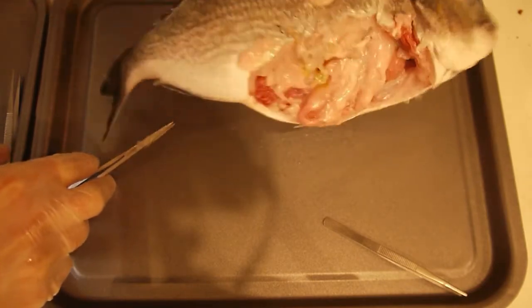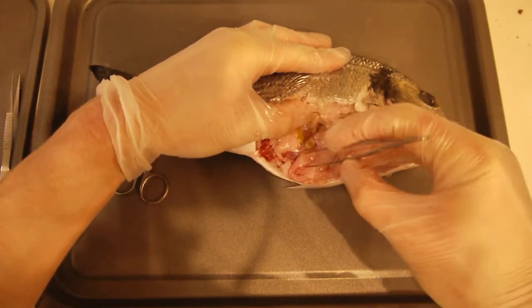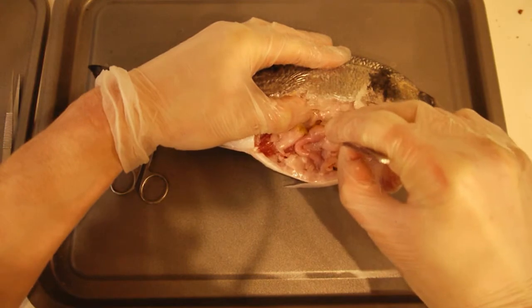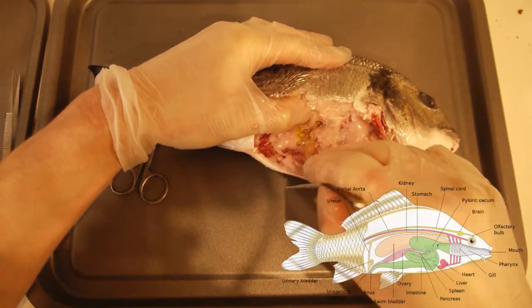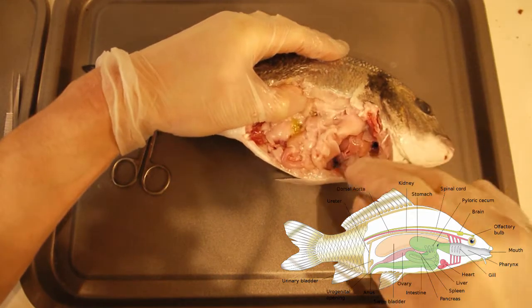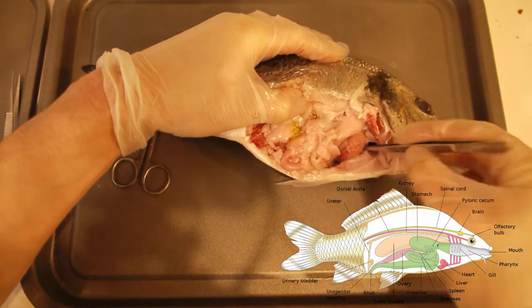We have a better view now. You can instantly see this long tubular structure — that is, of course, the gut. And we've got over here the liver, this dark vascular structure.